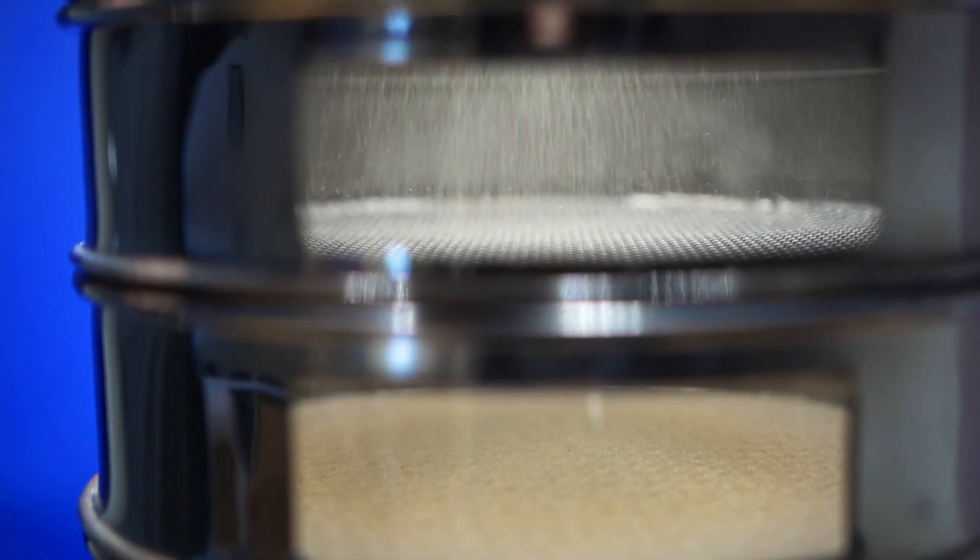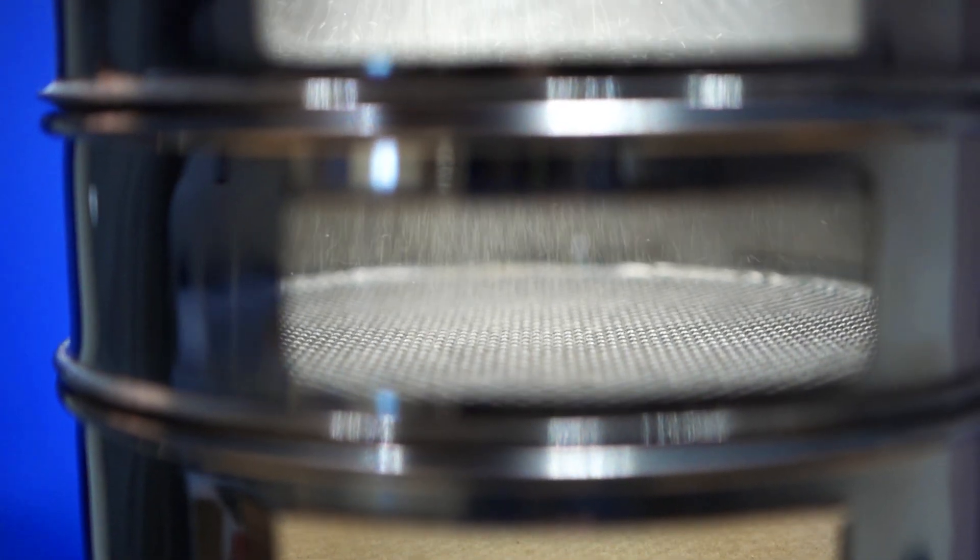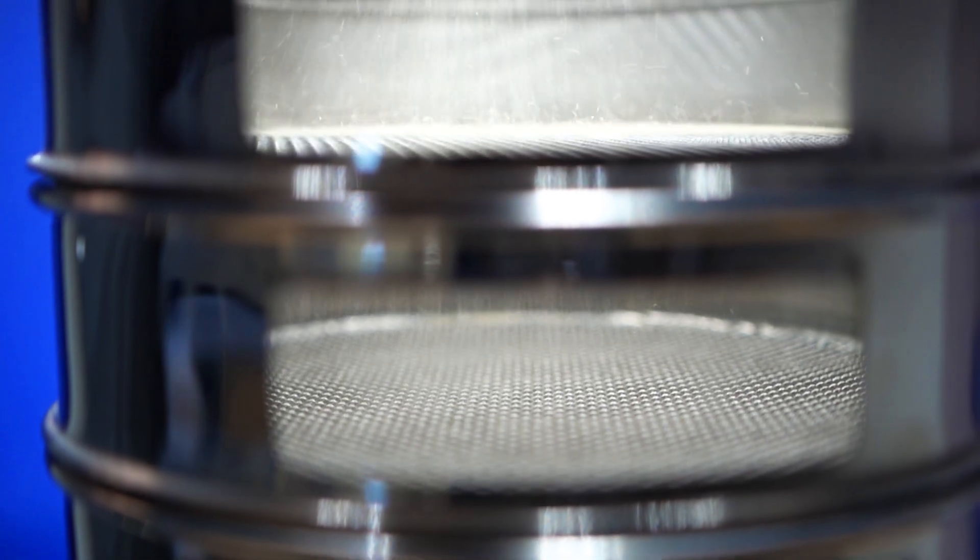When a sample is finished running through your test sieves, the sample weight is compared to the varying weights of sample material retained on each sieve. From this you can calculate the distribution of the material, but you have to know the initial weight of your sample — there's no way to yield a reliable distribution curve without it.